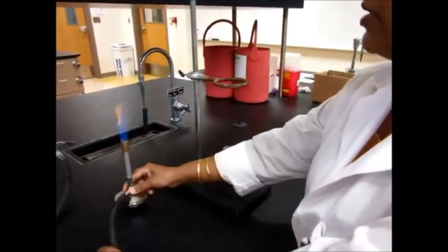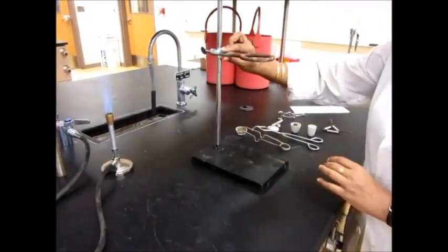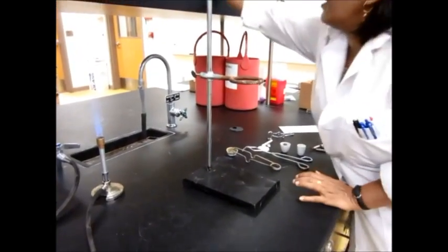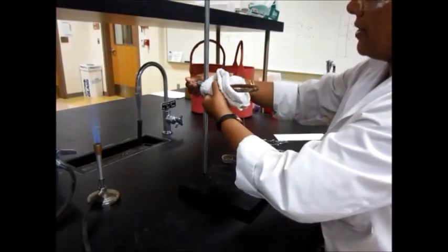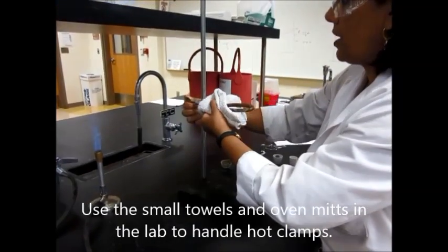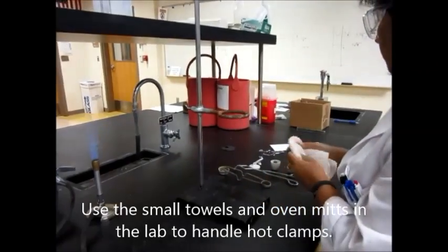Go ahead and remove the Bunsen burner and keep it aside. Please make sure that this is cold and still not warm or anything. But if it is, then take a paper towel or something and lower this down just a little bit. And now it should be all fine.